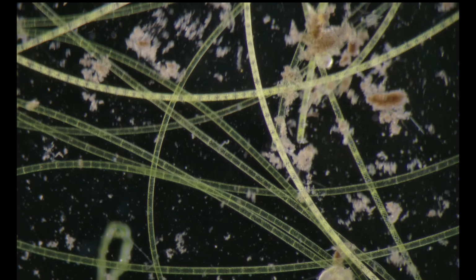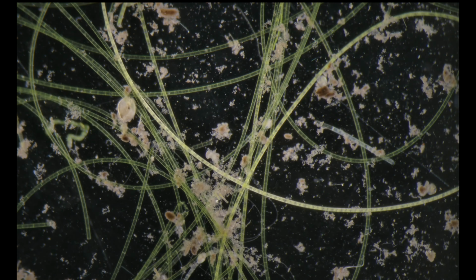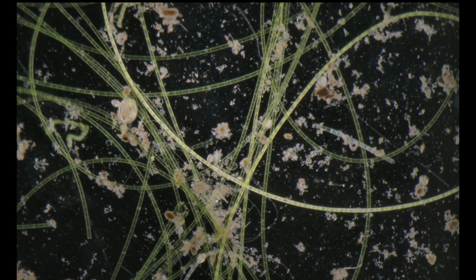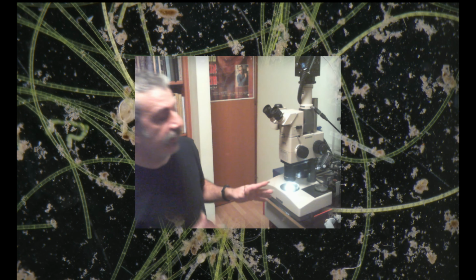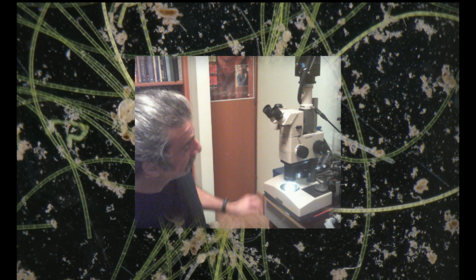I just want to emphasize that although this one is a somewhat fancy microscope, you don't have to get such an expensive instrument to use those techniques. I think any stereo microscope that can give you a zooming factor of 4 at least will be very, very beneficial to you.